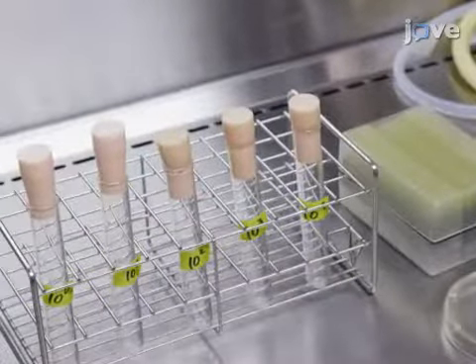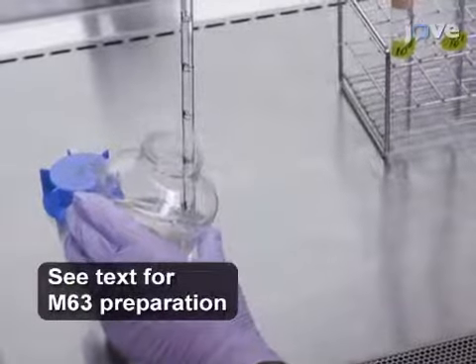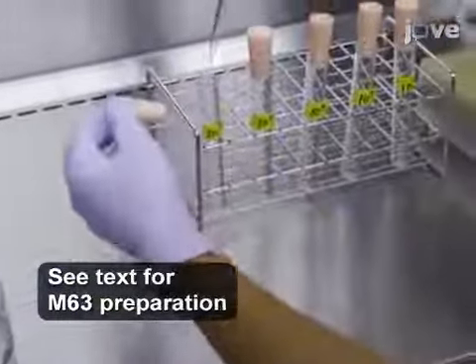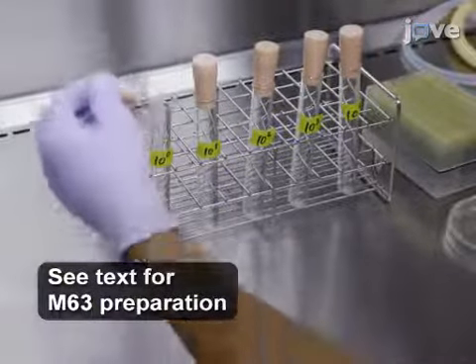on the glass tube. Next, use the electronic pipette and disposable serological pipette to add 5 ml of M63 to one of the glass tubes and 4.5 ml of M63 to the other 4 tubes.